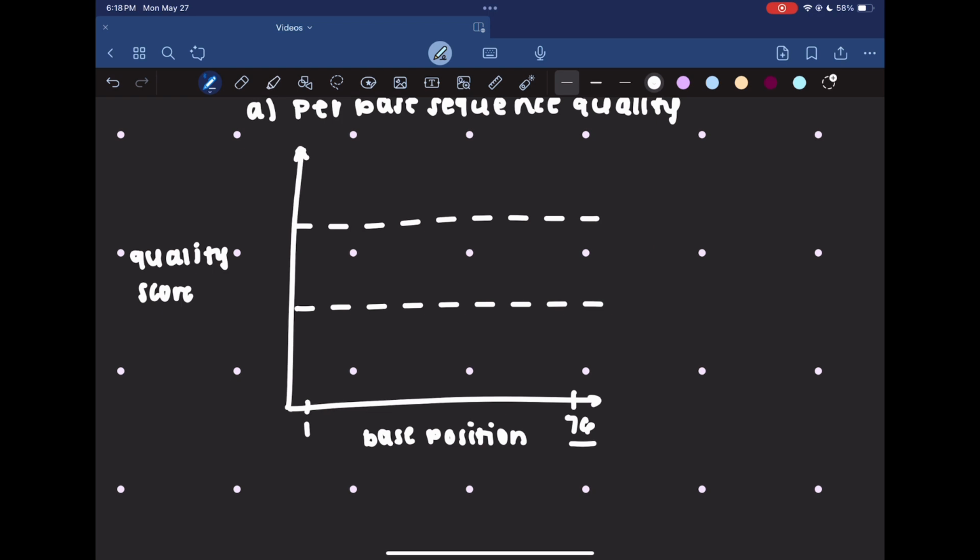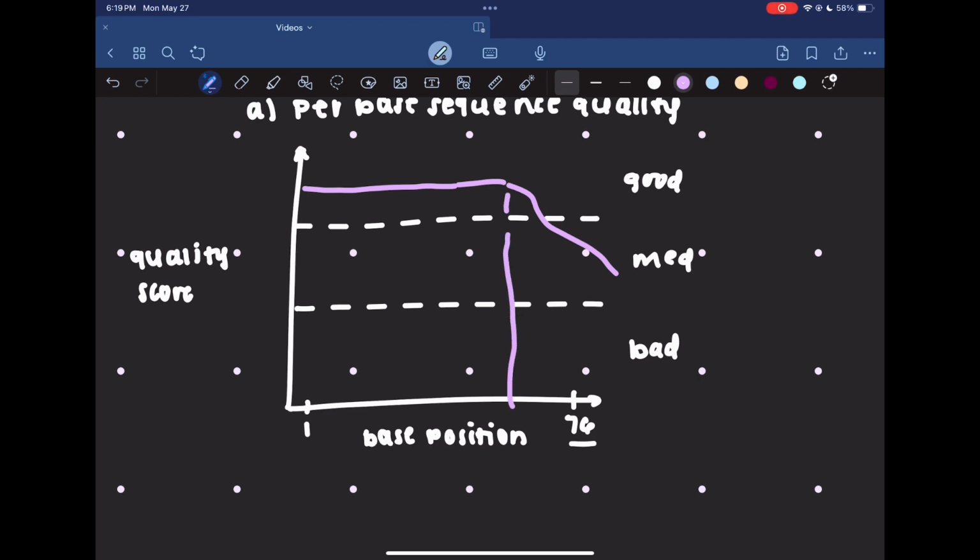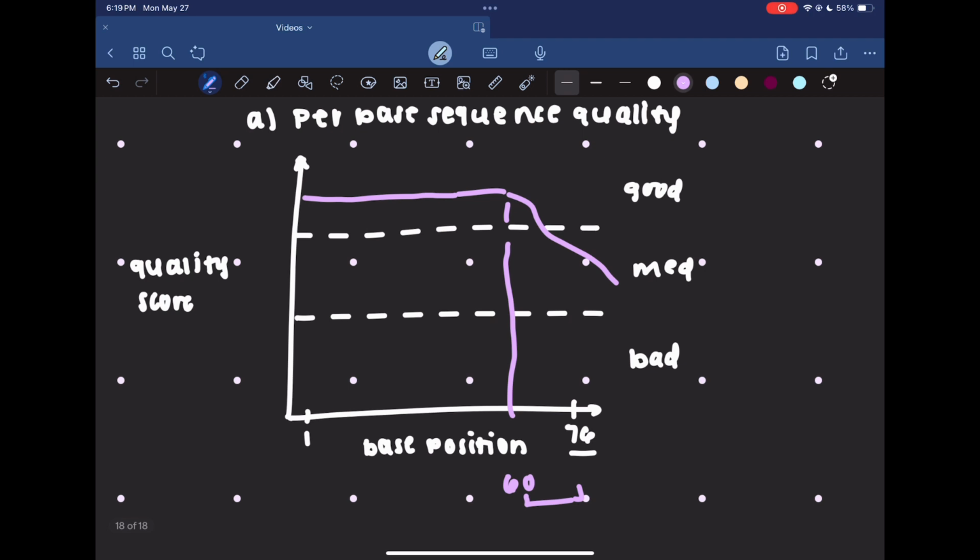And really what you're looking at on this graph, I can just draw some sample data of what it might look like. Maybe you have really good quality at the start, and then it drops off at the end. So generally, a higher Phred score is good, and a lower is bad, right? So maybe my data looks like this purple line. I have good quality bases, good confidence in my base pairs until maybe I drop off around 60 or something like that. And this is pretty common to see, the quality drop off at the end. And in my detailed FASTQC video, I can get into why that is.